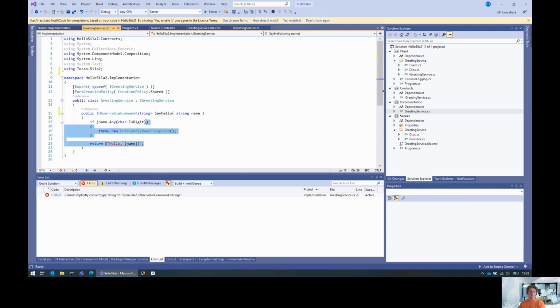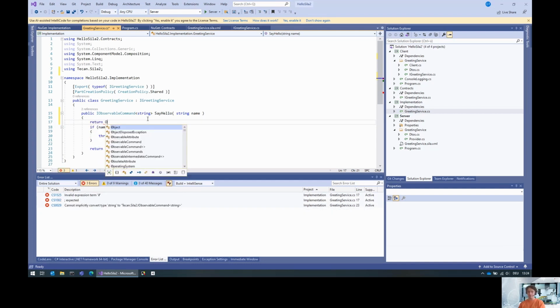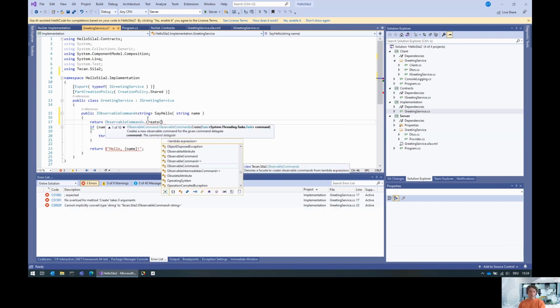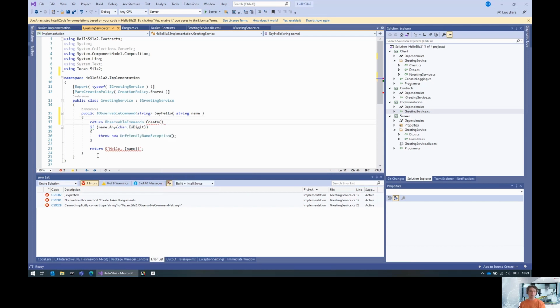And then, the easiest way to implement an observable command is using the default methods, and you can say you want to create this by, and then provide a function that creates a task. But you can also create a function that takes an action which you can use to write the command state on it, and then create a task out of it.